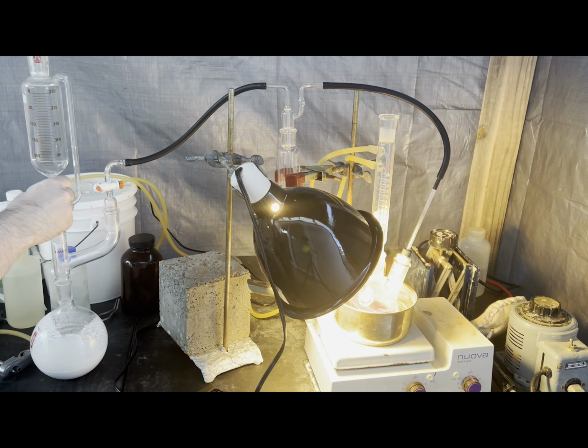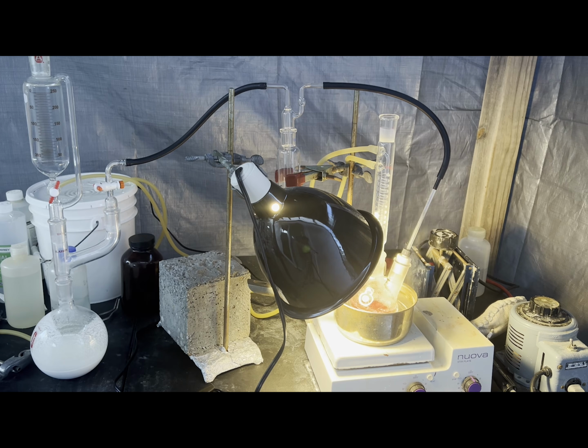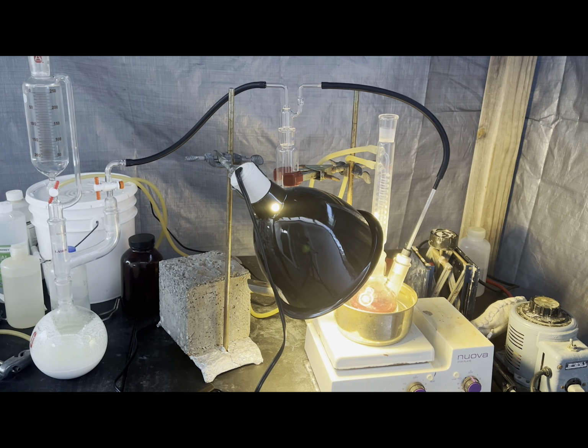So I did a whoopsie by starting the chlorine generator without realizing the stopcock of the gas outlet was closed, so it popped off. Teehee. Luckily, I did it before putting the joint clips on all the joints.